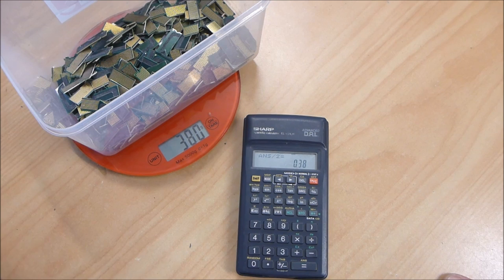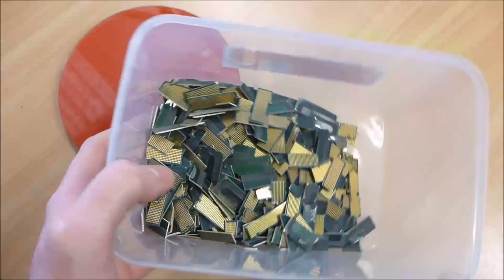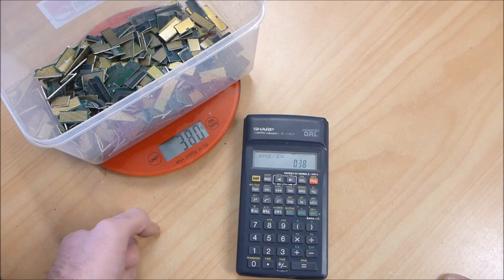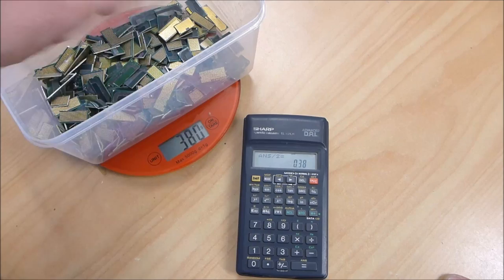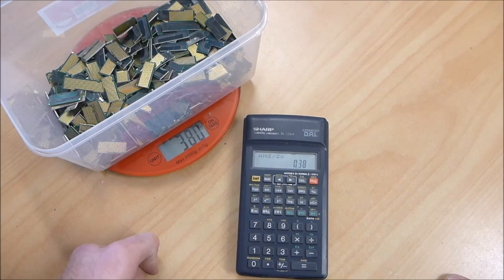I am going to process this as you normally would with RAM fingers with AP, the acid peroxide process. There are quite a few videos already online about doing that. It's probably going to take about a week or so to get all these foils off because it's getting a bit colder here.